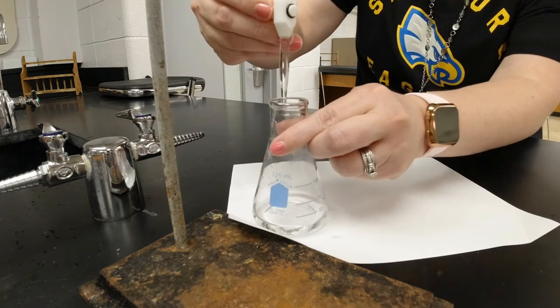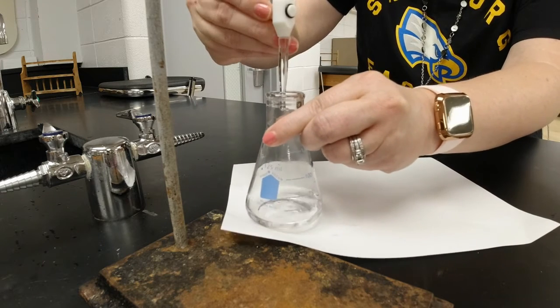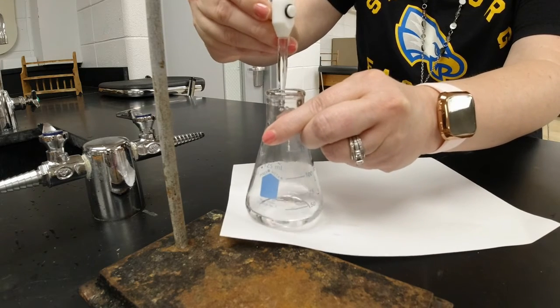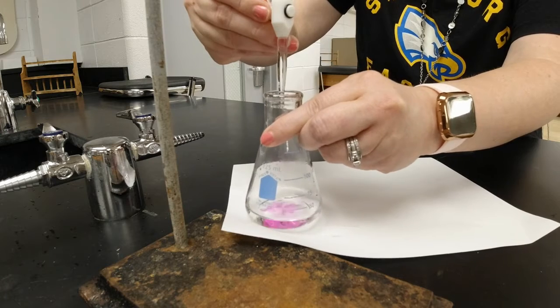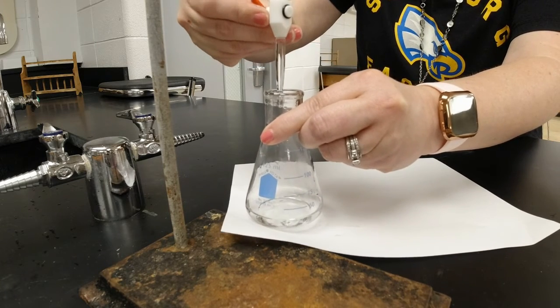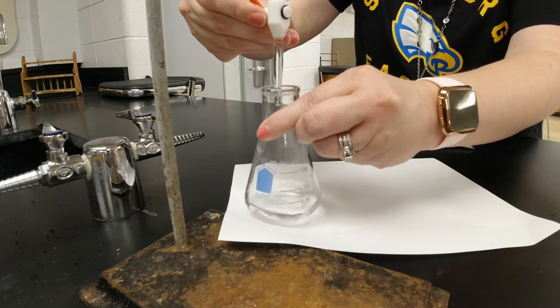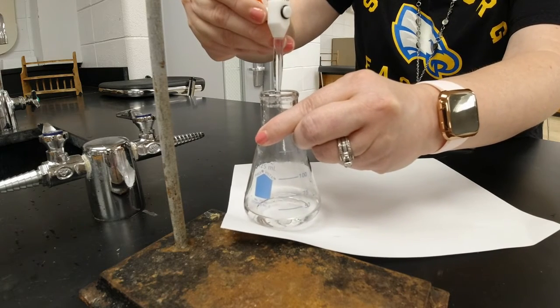I should probably move my hands. Now you got it. Oh gosh. Yeah. It goes fast. This is tricky. Yeah, it goes fast.